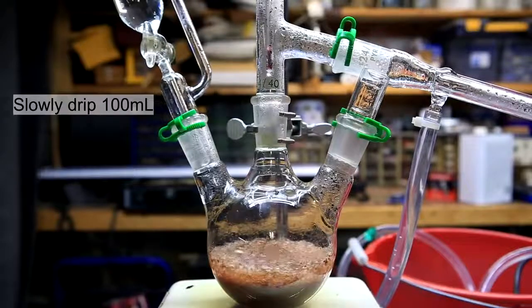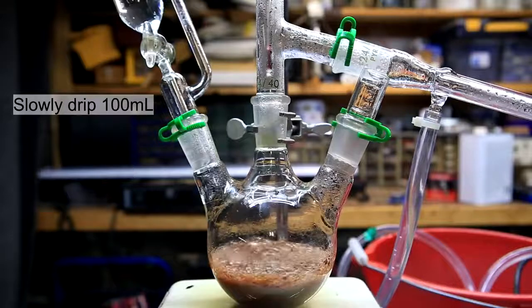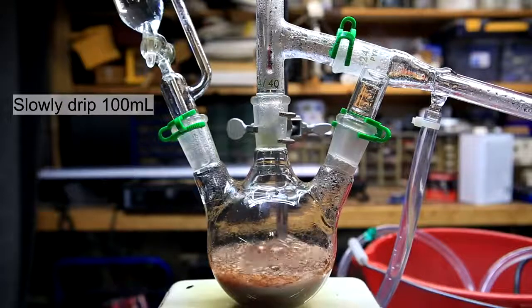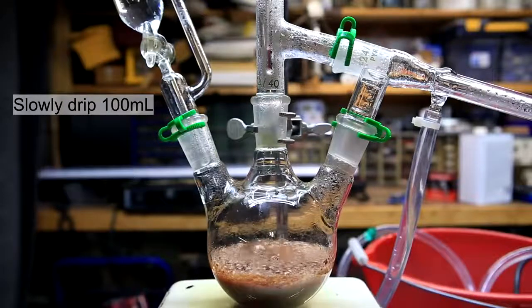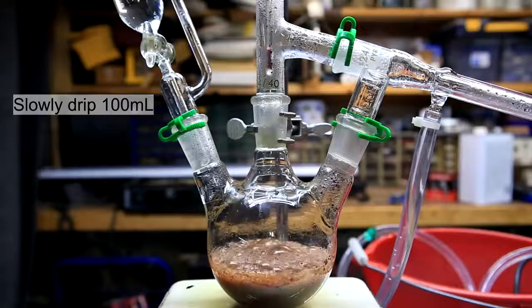To do this I slowly dripped in 100 milliliters of water from the addition funnel. The addition funnel allows us to add water while keeping the distillation going but you could also pour in 100 milliliters of water and just heat the mixture up again.